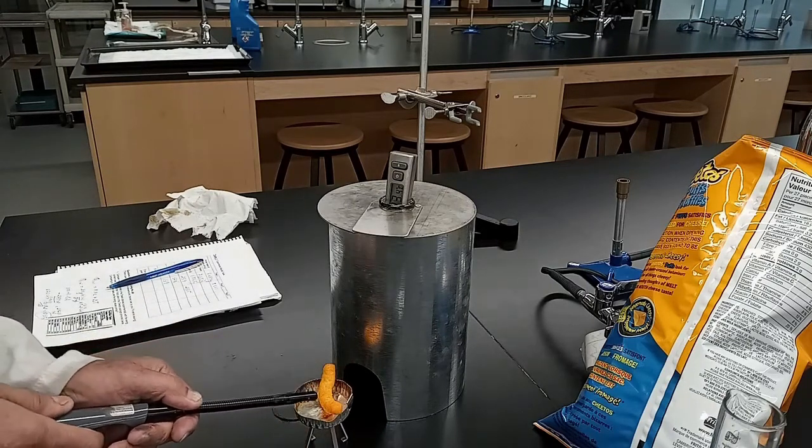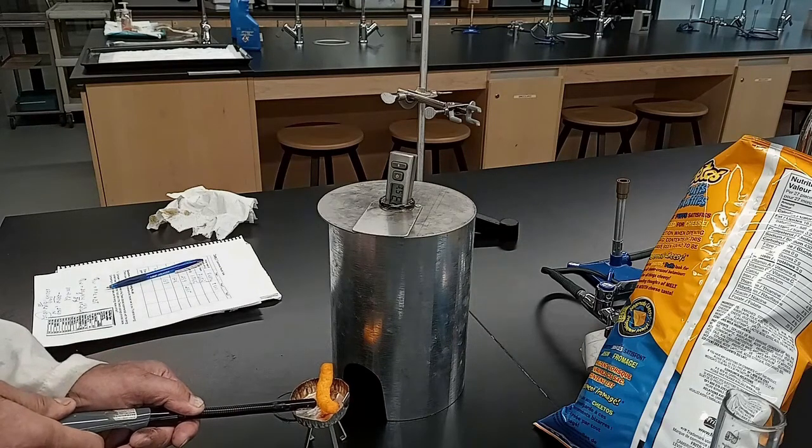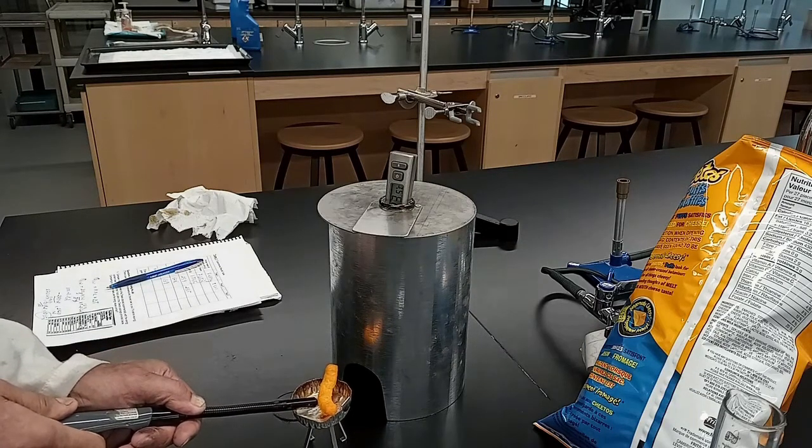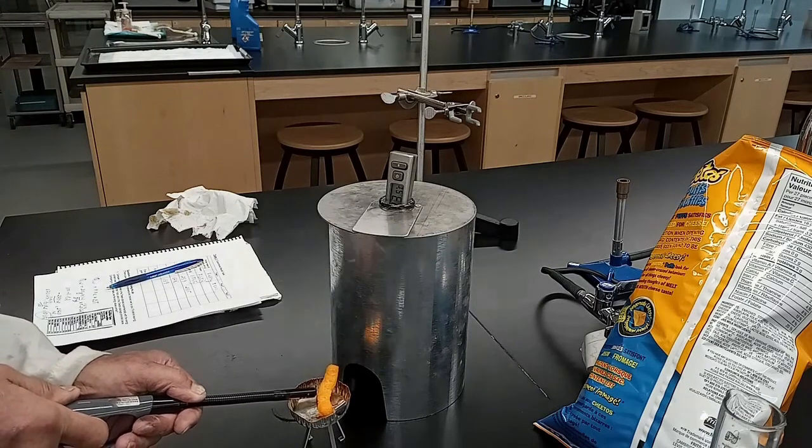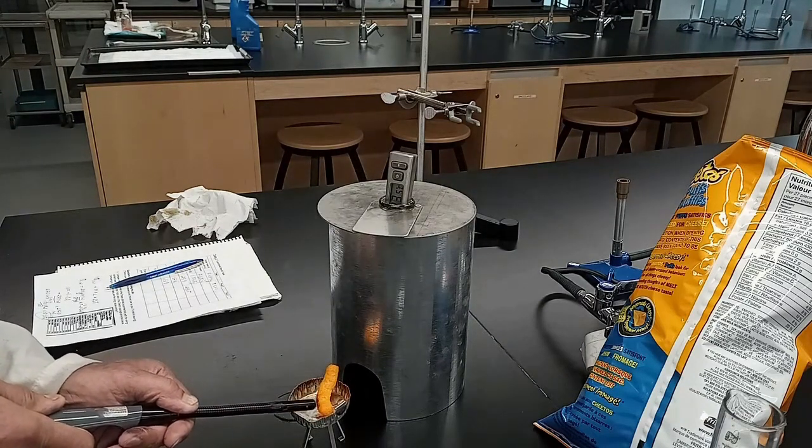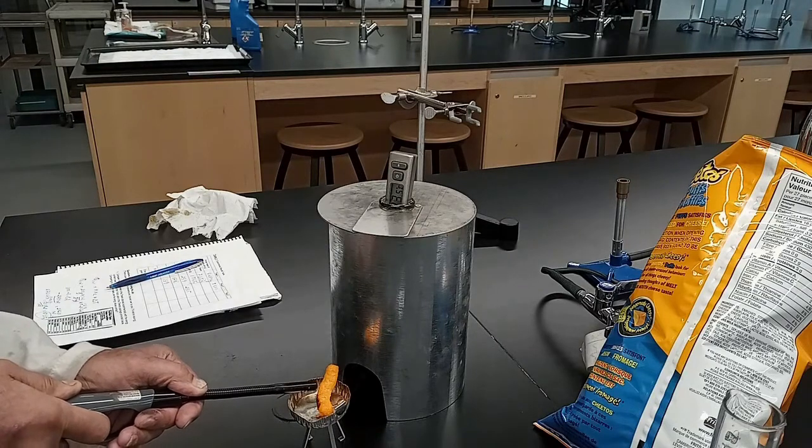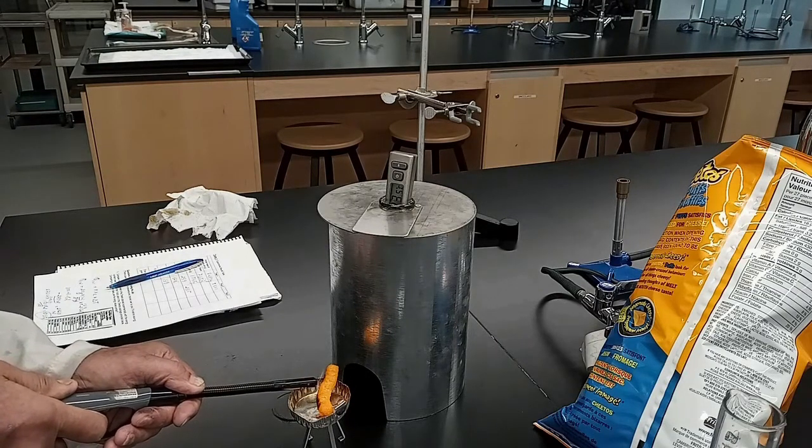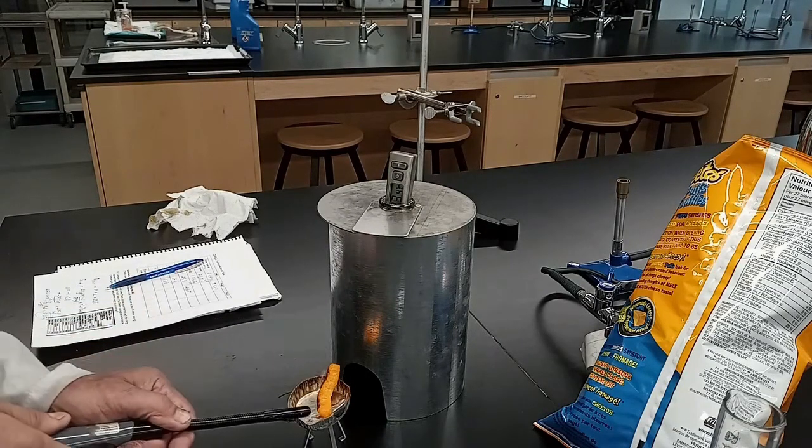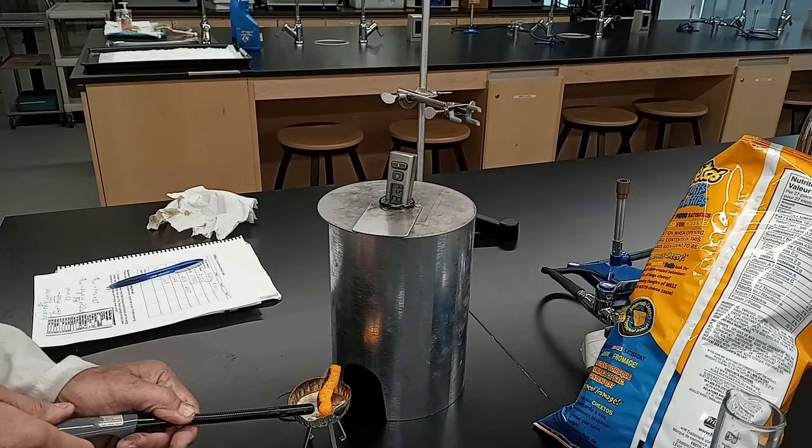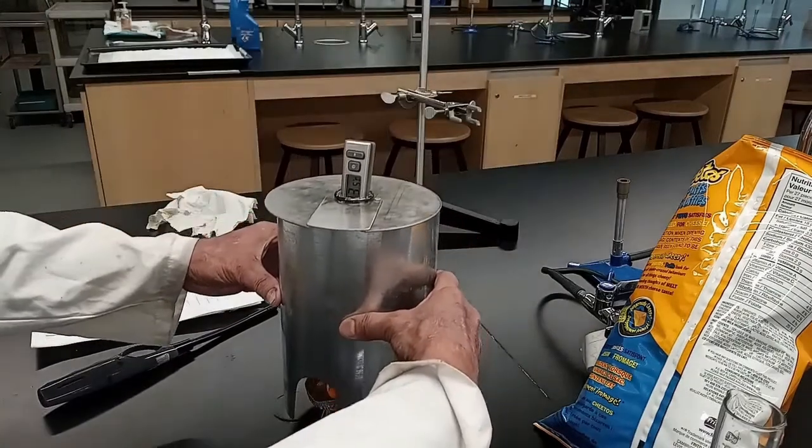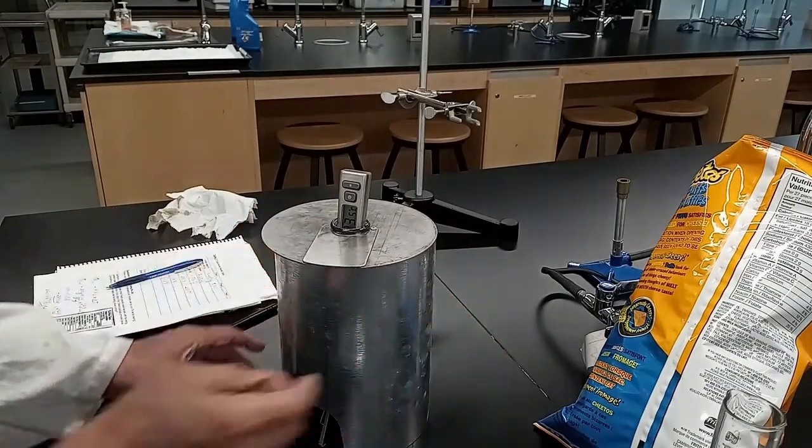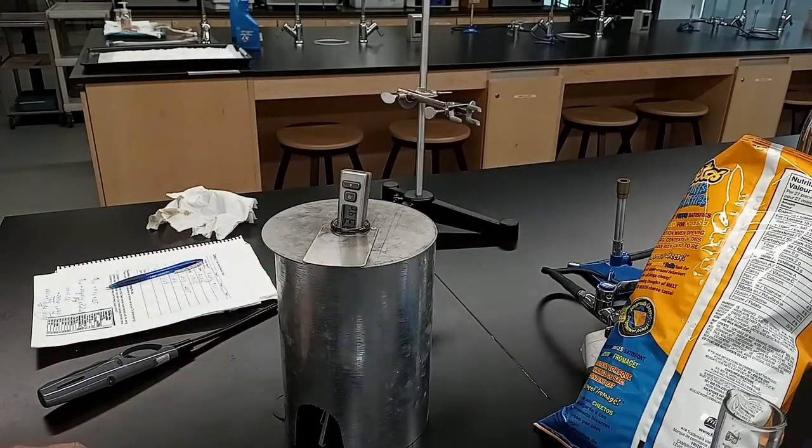Ignite the Cheetos. Once ignited, place the calorimeter over the burning Cheetos.